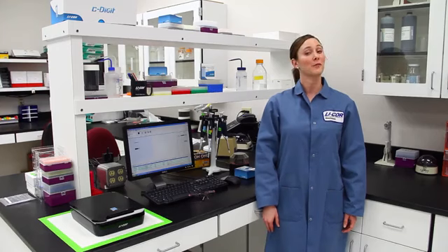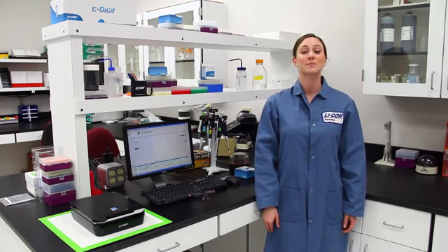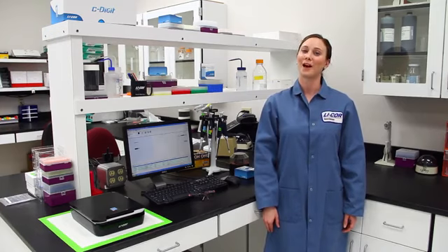Even though your bands might appear really similar upon visual inspection, make sure you analyze each band separately in Image Studio for an actual digital comparison. Following these tips will show you how the C-Digit maintains the simplicity of film without the mess of the darkroom.